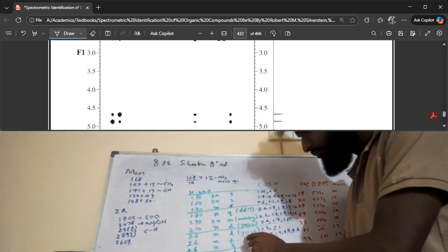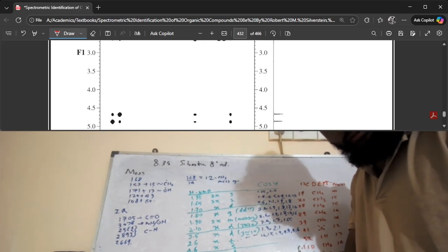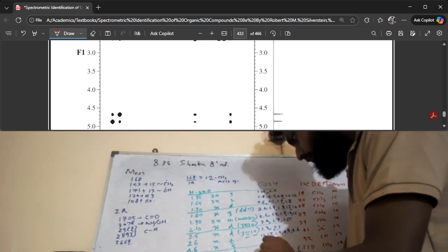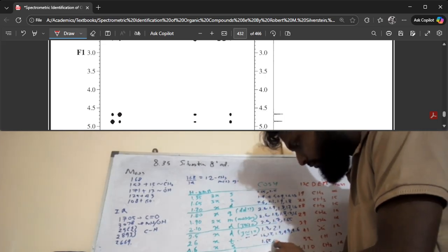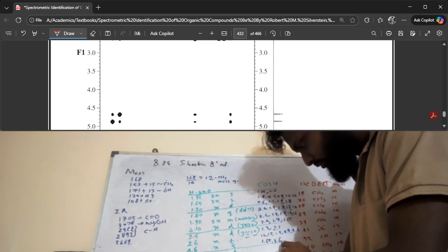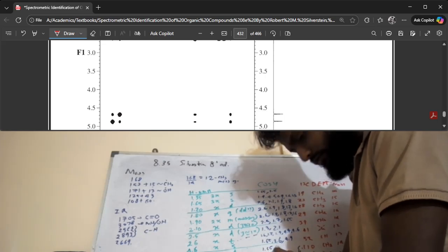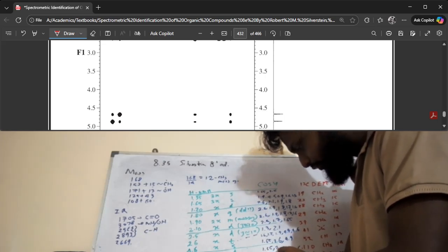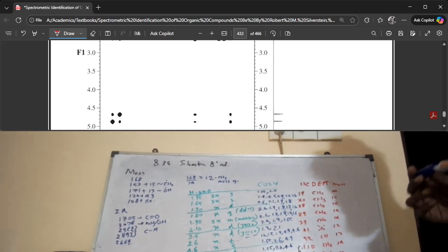So this one is this. The 4.6 is correlated with 1.65. Again, these are very confusing, right? It's not supposed to be doing this because 1.65 is a singlet. 4.9, and then finally, this is again correlated to 1.65, 2.6, and 4.6. So these are our COSY correlations.